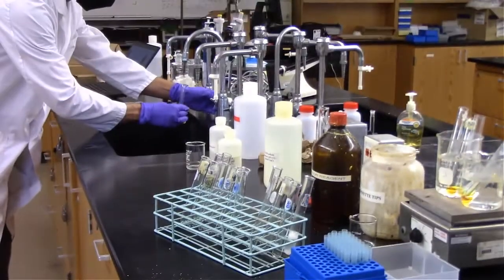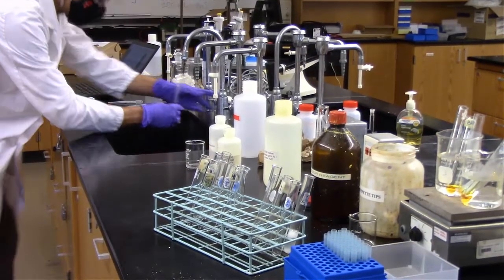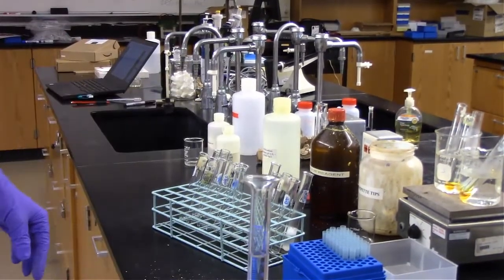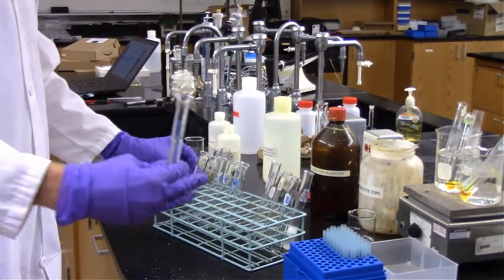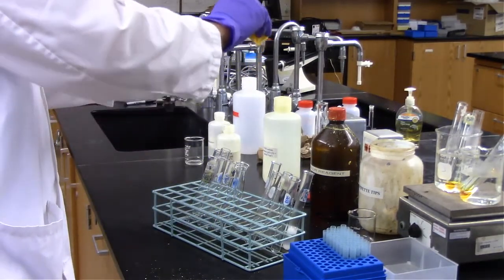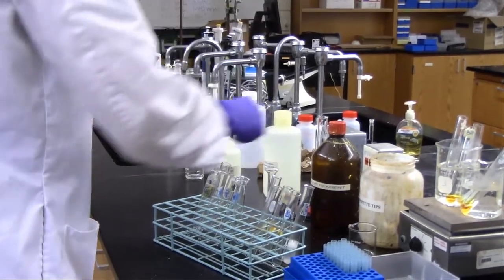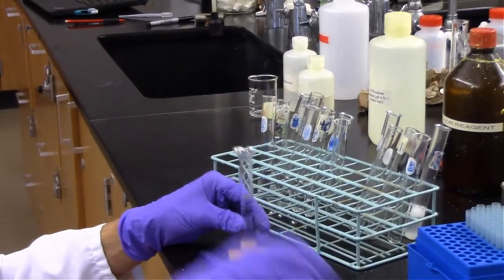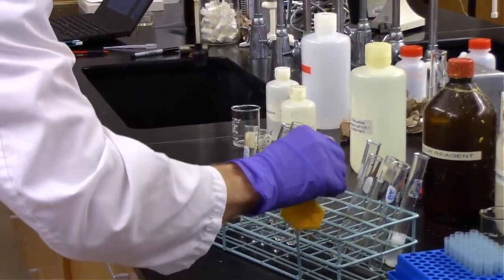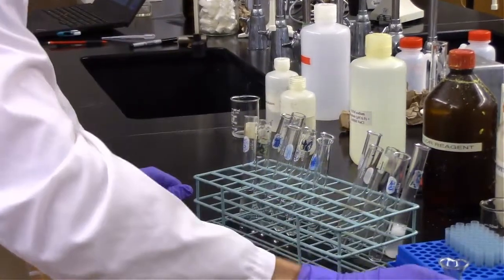And next, to prepare for the analysis of each of our samples, I'm adding 8 milliliters of water to 5 additional test tubes. That way when I take my samples off the hot plate, I can add all those in very quickly to stop at 5 minutes. So this is the last test tube that has 8 milliliters of water.